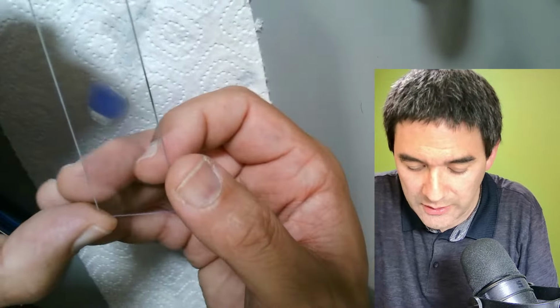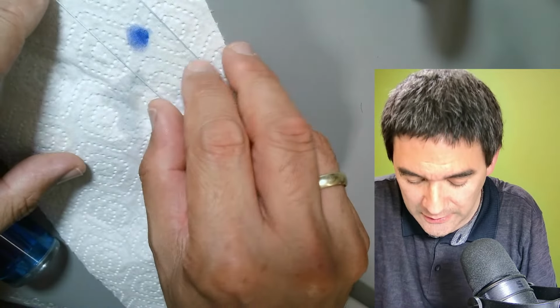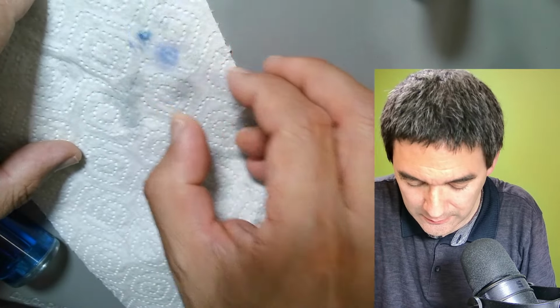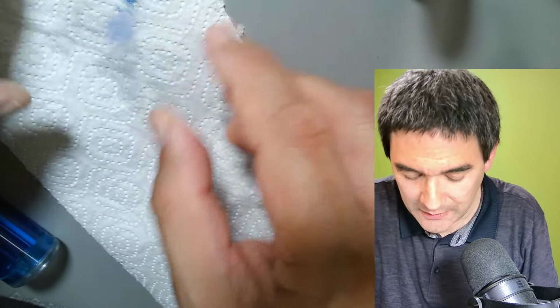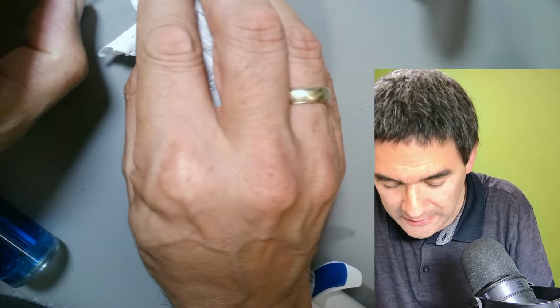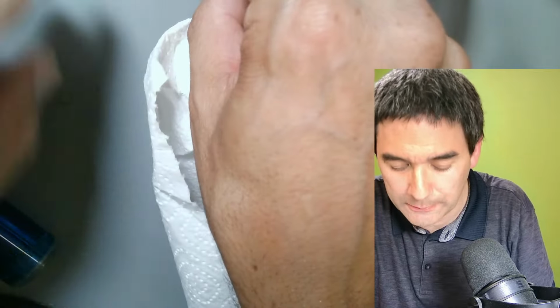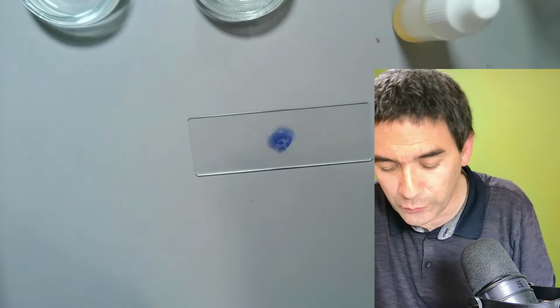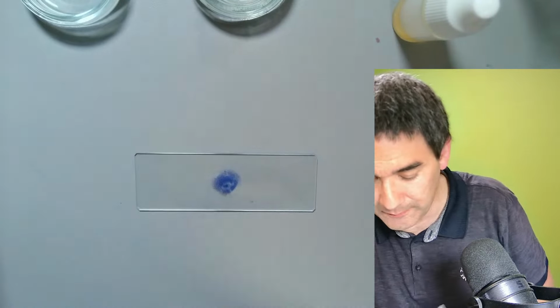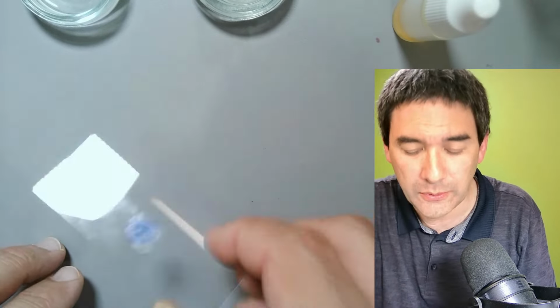So what I'm going to do is what you normally don't do. I'm flipping it around. You see some of the cells. Maybe I just have to wait for a minute or so until it completely dries. If there's water present, of course you do not want to mix it with oil. Well, it's kind of drying already. Maybe you want to shake it a little bit here.